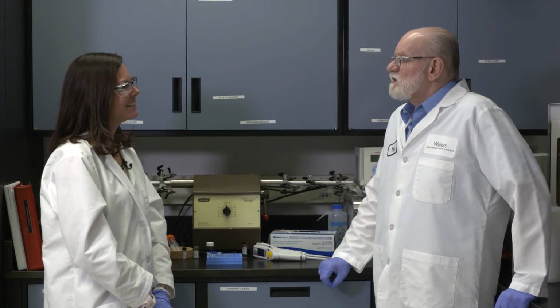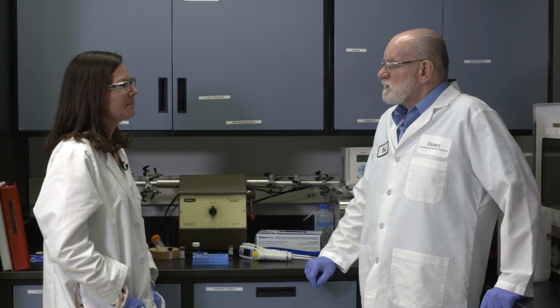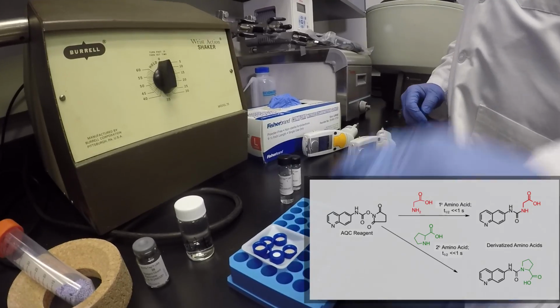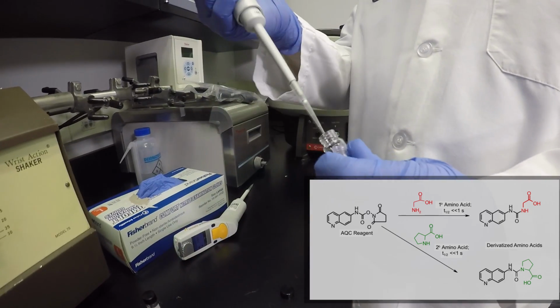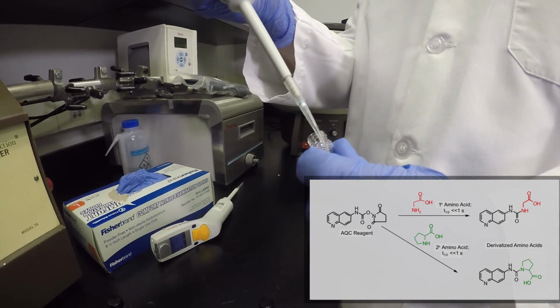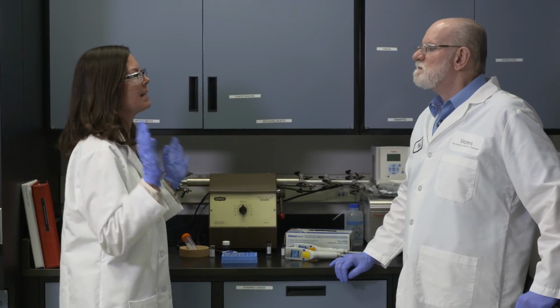So to make it easy for our users to get the information on these complex samples, we decided to put together a turnkey solution that would include the use of a derivatization reagent that would make the chromatography easier and make the detection easier, and to use a reagent that we understood the chemistry very well, where we had a lot of experience. Great, so this is the sample prep piece of the solution.